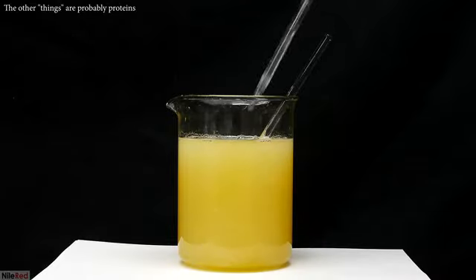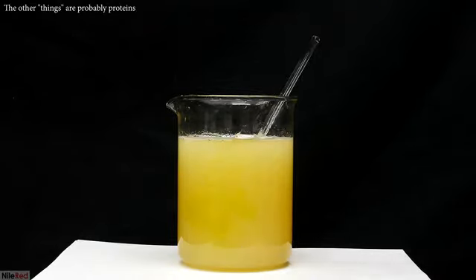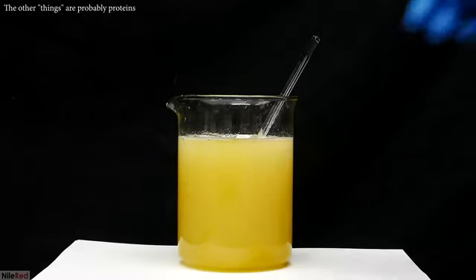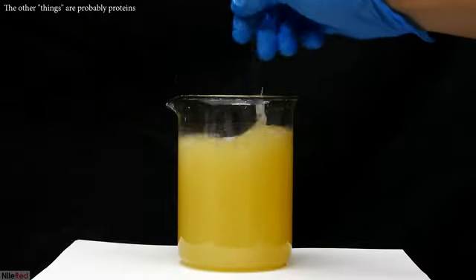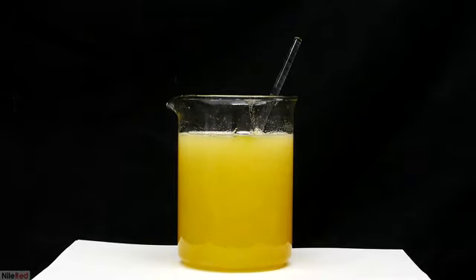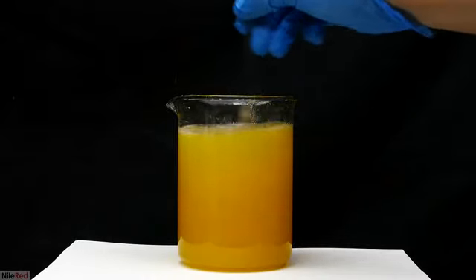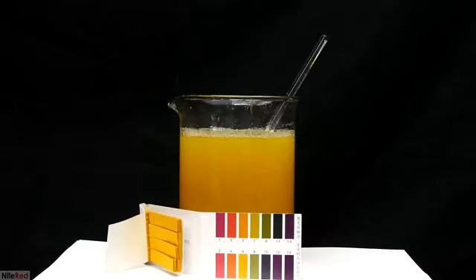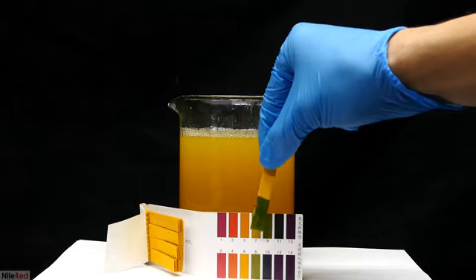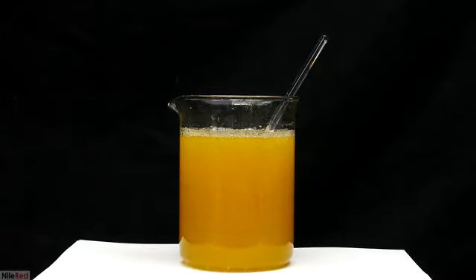As the pH increases, the solubility of other things will decrease. This will cause a lot of them to precipitate out, and as we continue to add sodium hydroxide, more and more solid will form. I know I'm very close to a pH of about 8 or 9 when the addition of sodium hydroxide generates an orange color. I test the pH, and I see that it's around 9. If the pH is a little bit higher than 9, it's probably still okay.